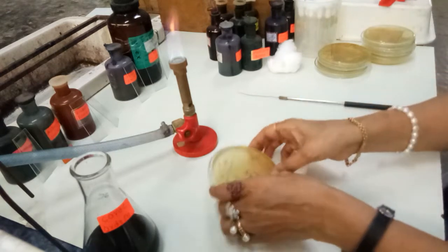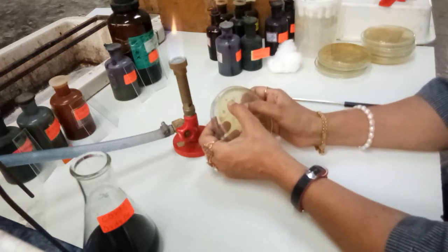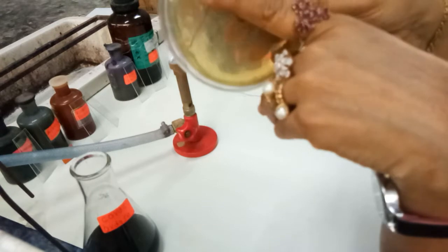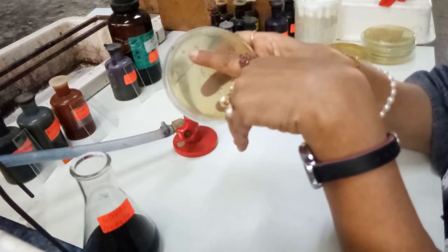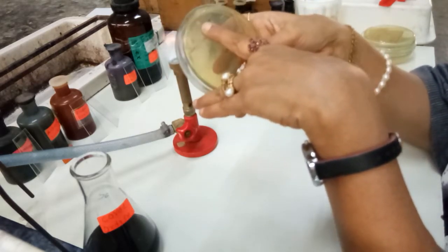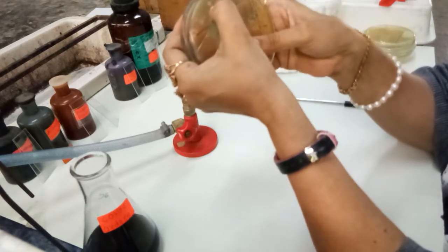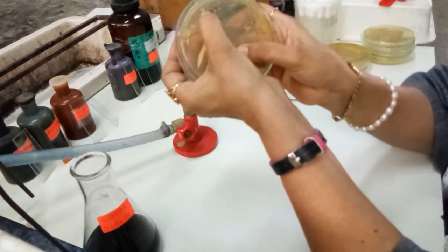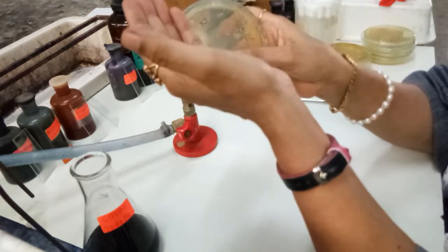Okay, so I will start with the size of the colony, shape of the colony, margin, elevation, texture, opacity and color. Now let us discuss all these criteria for lactobacillus group of organisms. Okay, so here the colony is big in size, the shape is round, opacity is opaque, non-transparent, margin is entire, it is very smooth in appearance, the texture is very smooth, elevation is slightly raised, and color is dirty white. So this is about colony characteristics, and it has to be written before we use the colony for some other purpose.